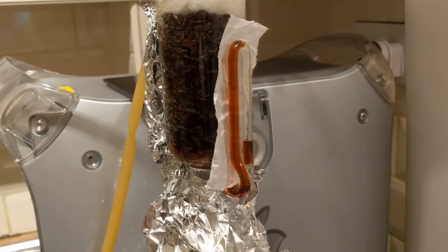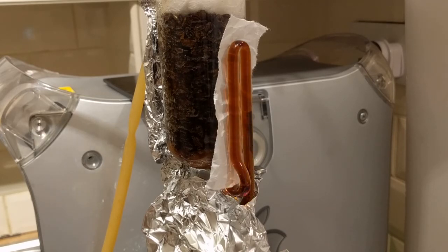Finally, I know it's very disappointing that I don't have a nice video of the Soxhlet extractor running, but I have one in a future video. Here's a nice preview. I promise I'll show it next time.